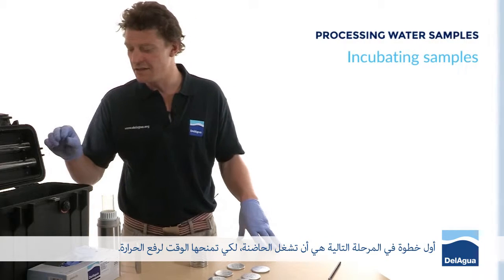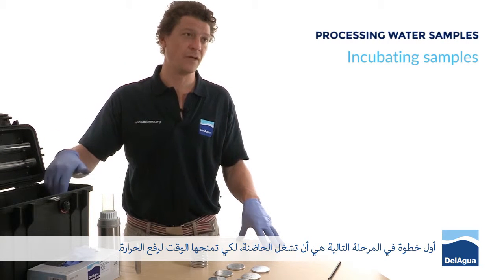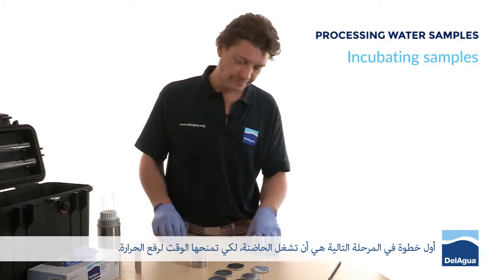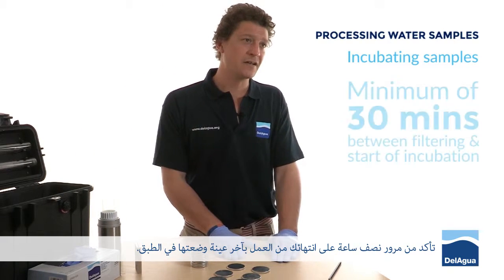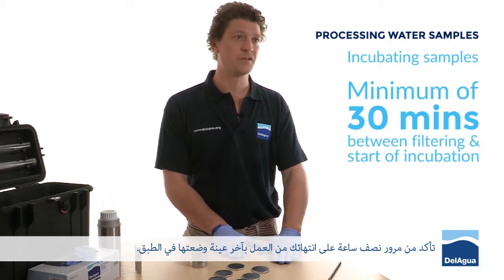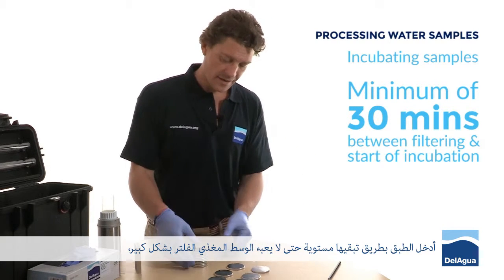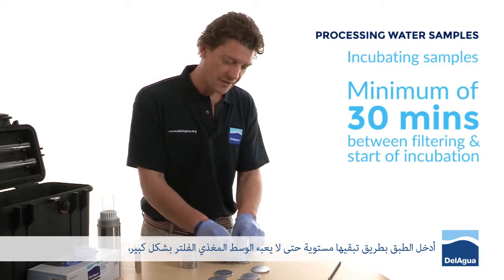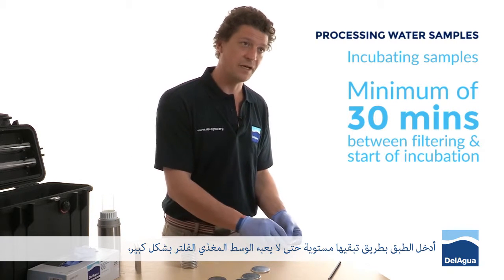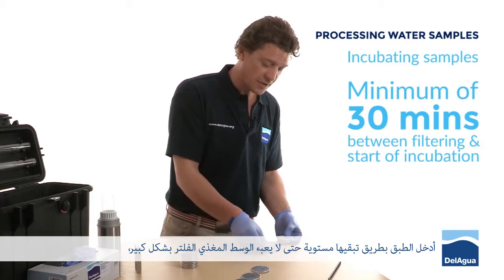The first thing to do at this stage is to turn the incubator on in order to give it some time to run up to temperature. Ensure that at least half an hour has passed since you finished processing the last sample. Take your petri dishes and slide them — keeping them flat so the media doesn't wash the filters and pads too much.